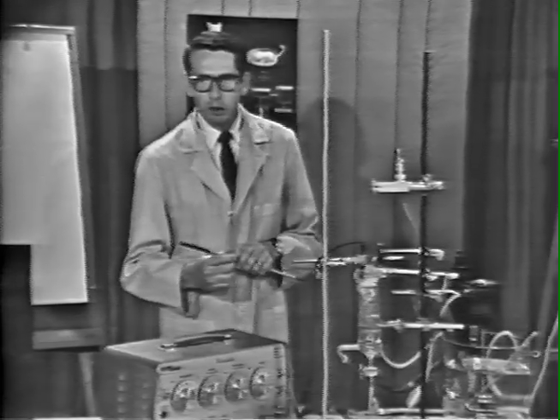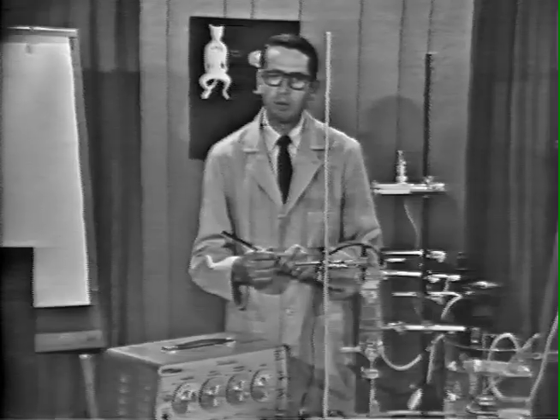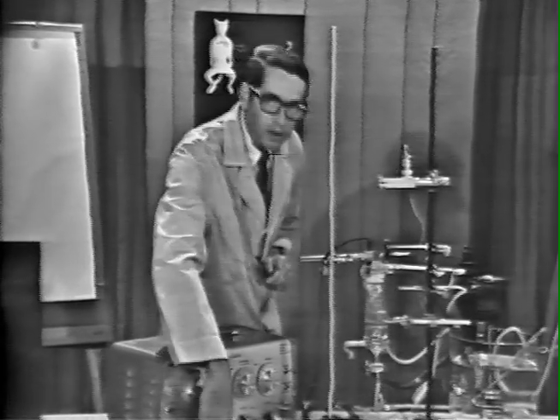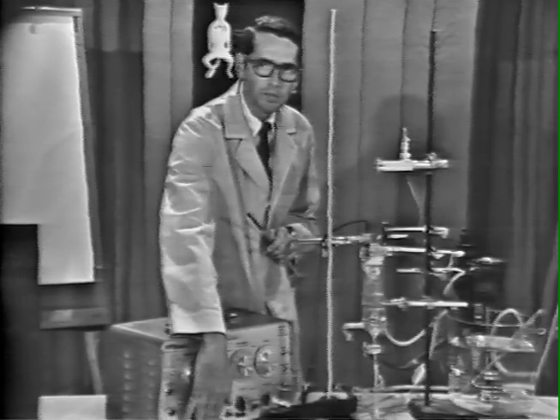In this and in subsequent stimulations, we are going to use 100 impulses, so that we will therefore apply stimulation at 1 per second for 100 seconds, so that we can now apply stimulation and obtain the responses. The stimulation is now on at 1 per second.